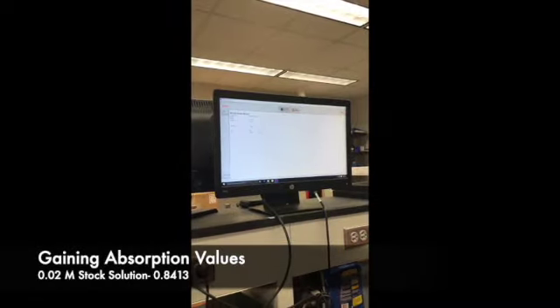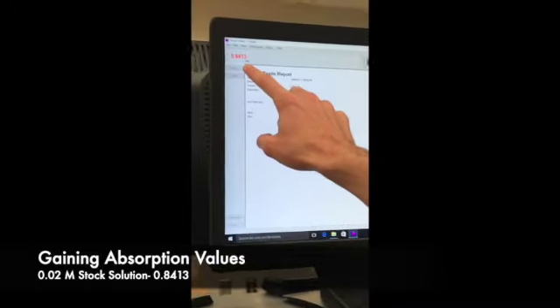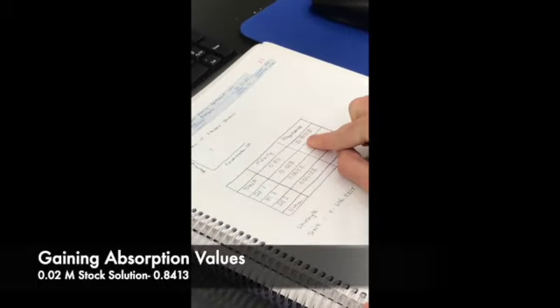Looking at the video here, we have set the stock solution into the spectrophotometer, and now we get the reading 0.8413 for our stock solution, and we will write that down in our notebook.